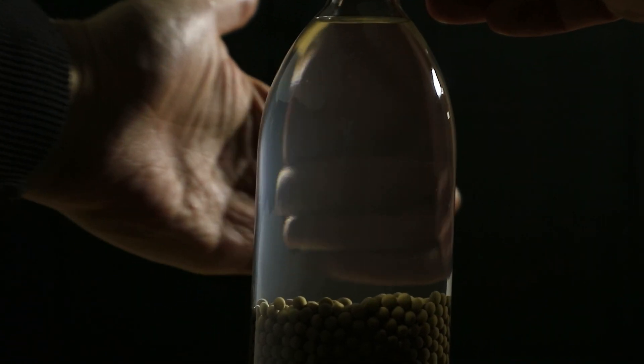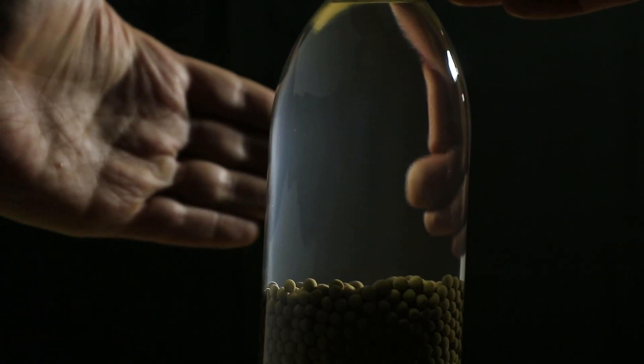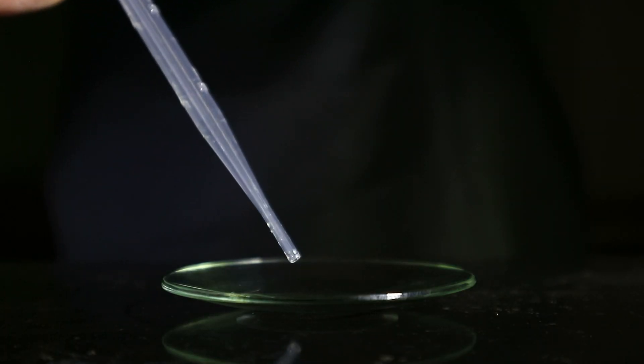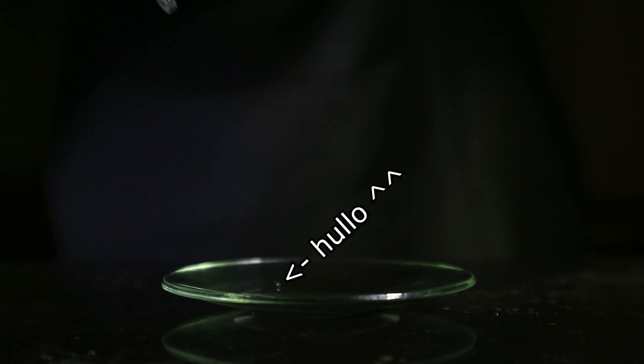It's murky. It's annoying to look at but it's there. So let's just burn a little bit of it and enjoy the blue flame and then say that we've done a good job.